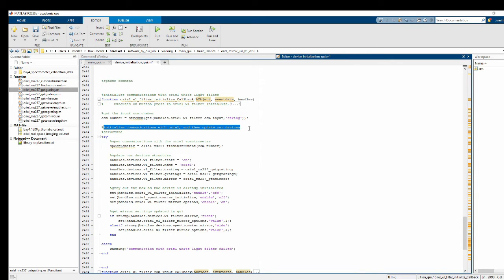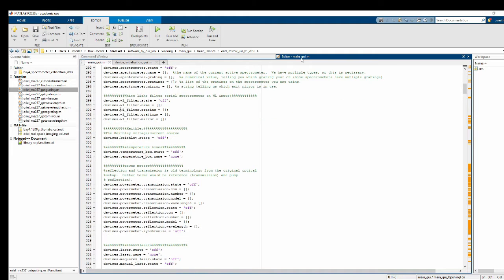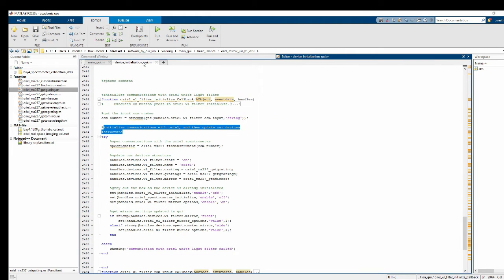So, initialize communications with Oriel, then update our devices structure. By the way, that devices structure that we make in main GUI, that will be passed to our device initialization GUI when we call it. And it'll then be passed back to main GUI after we make our changes. So all of this should get back to main GUI eventually. So go ahead and try to open communications with it. I guess we don't really need this spectrometer thing written here. That's just a handle to the device. And then we can update our devices so the state becomes on.